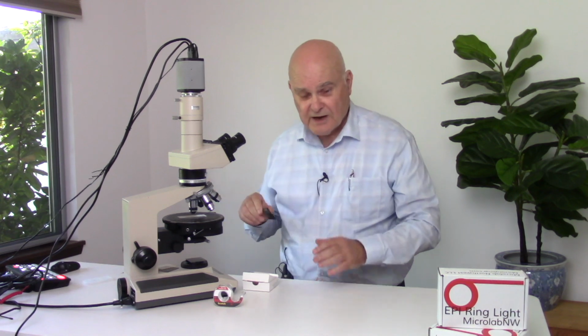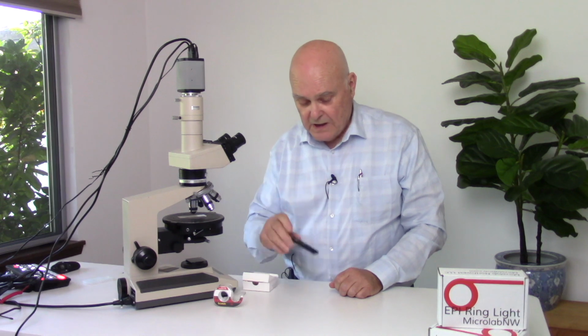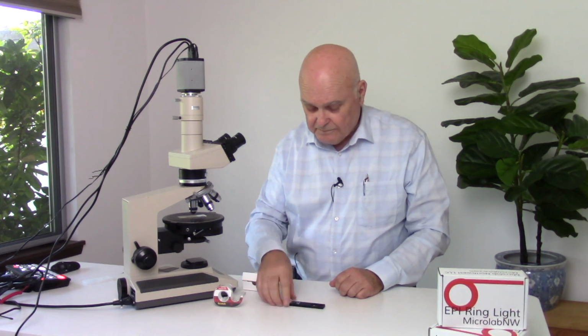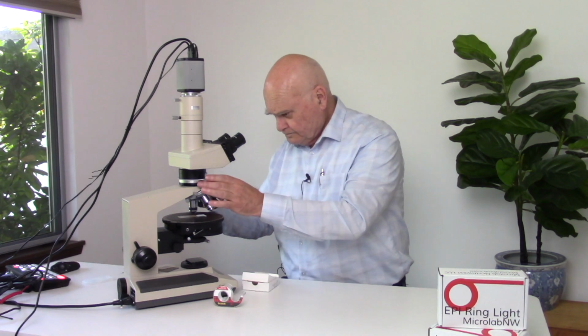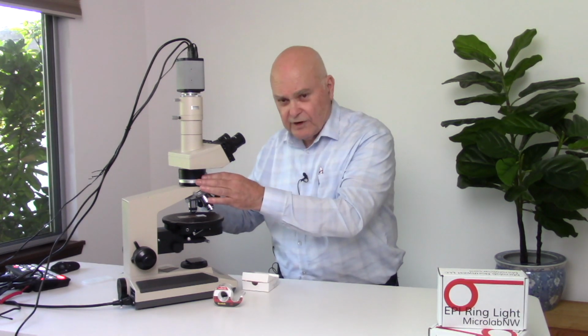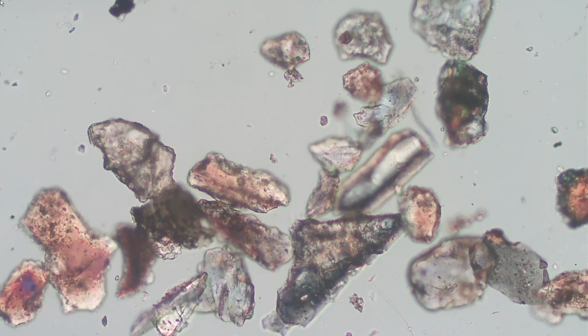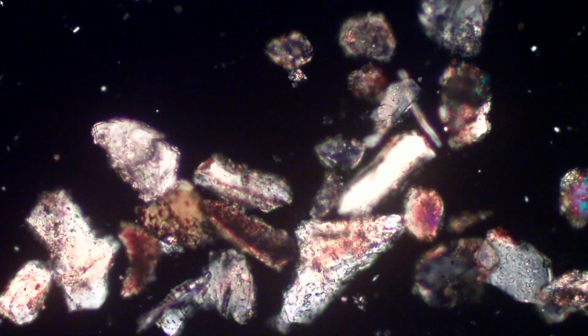Well, first thing we need is a polarizing light microscope, of course, and then we need a quarter wave compensator plate. The quarter wave compensator plate that is designed for the scope fits in just below the analyzer. Now, if we slide that compensator plate in, we automatically change the birefringence in the background. What we're going to do is to remove that for right now.